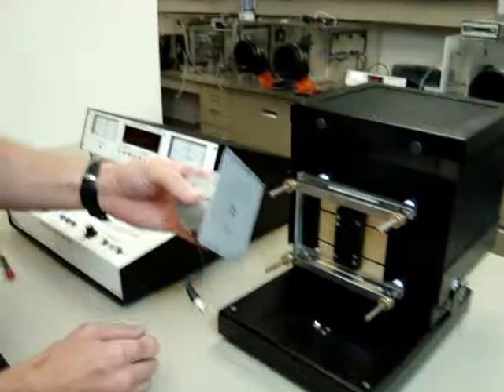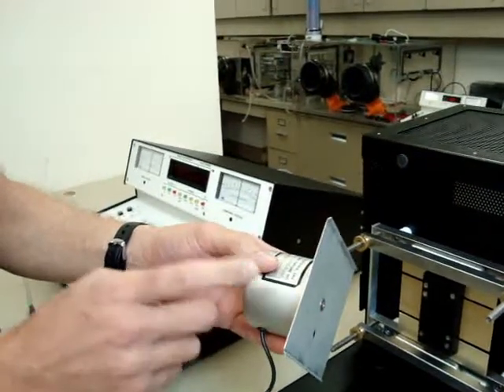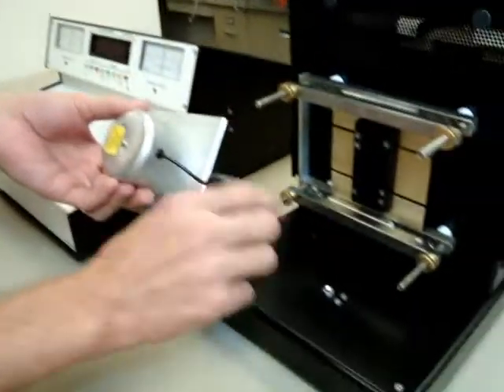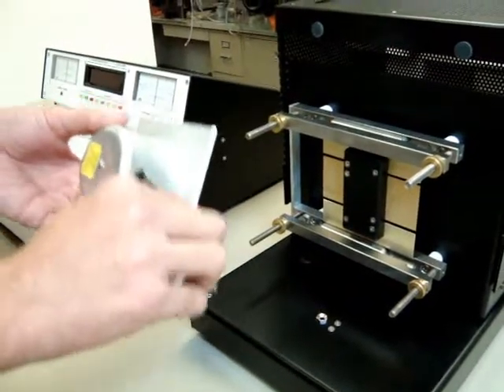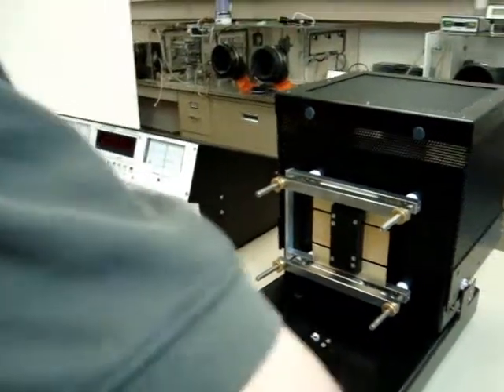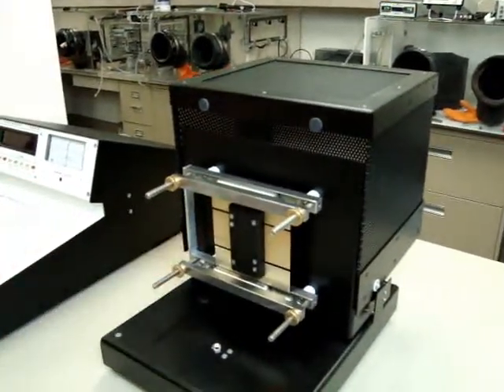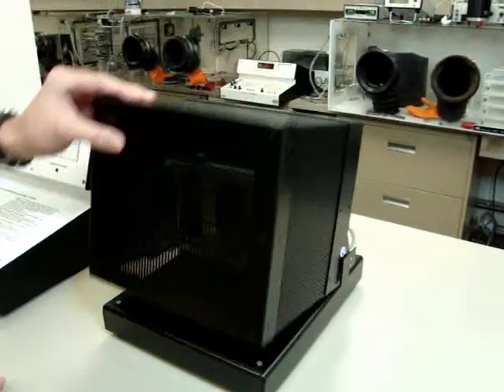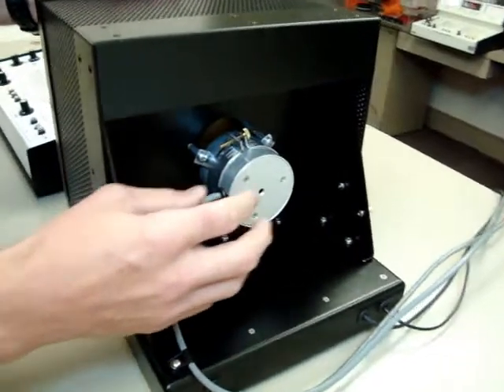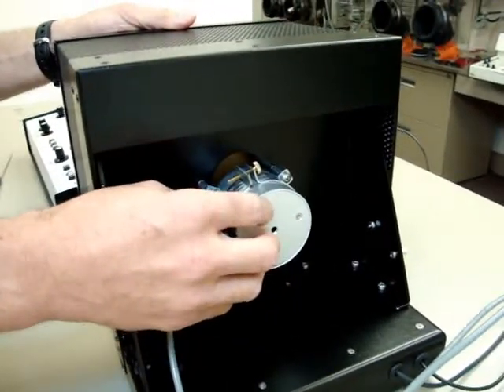It's not necessary to use the clamp electrodes for the STM-2, but we're doing it for demonstration purposes. Note that some older units have the STM-1, which has a plug that goes into the bottom of the cage — you have to seat that all the way down for it to operate correctly. All newer units will have the STM-2. The cage is set up. Also note that the sensor, when shipped to you, is already in the proper position.